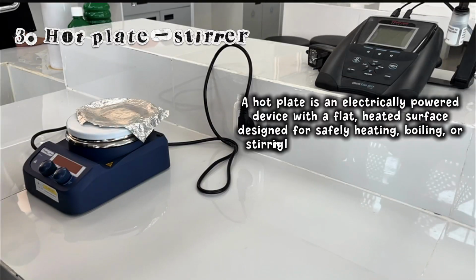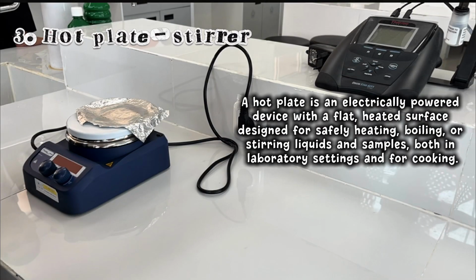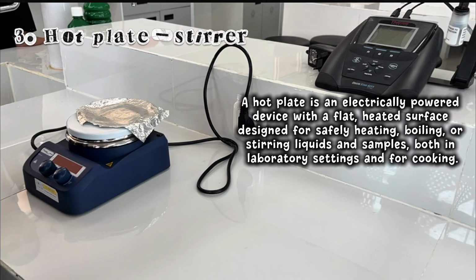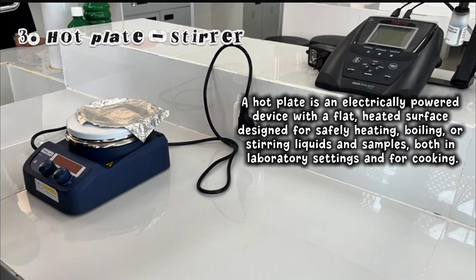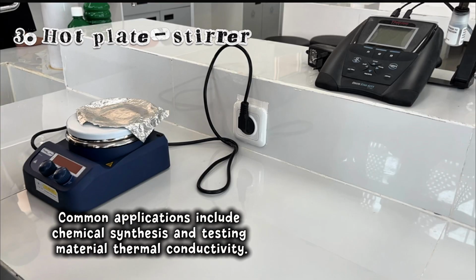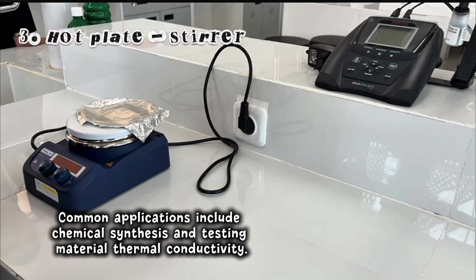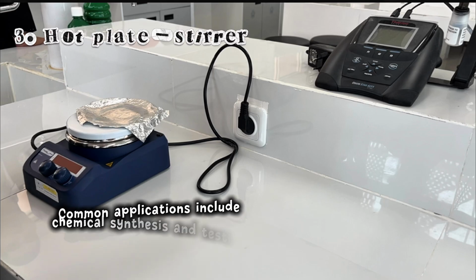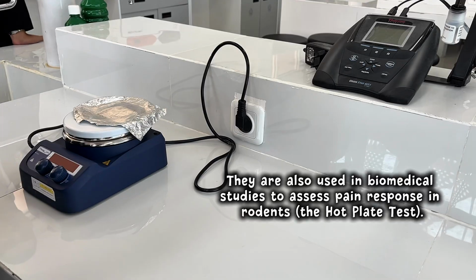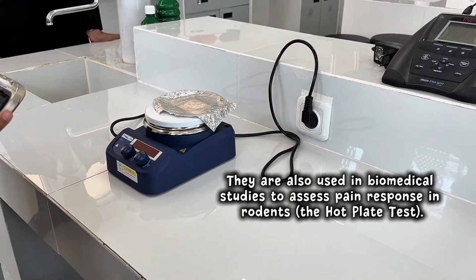Here is a hot plate, an electrically powered device with a flat, heated surface designed for safely heating, boiling, or stirring liquids and samples, both in laboratory settings and for cooking. Common applications include chemical synthesis and testing material thermal conductivity. They are also used in biomedical studies to assess pain response in rodents, the hot plate test.